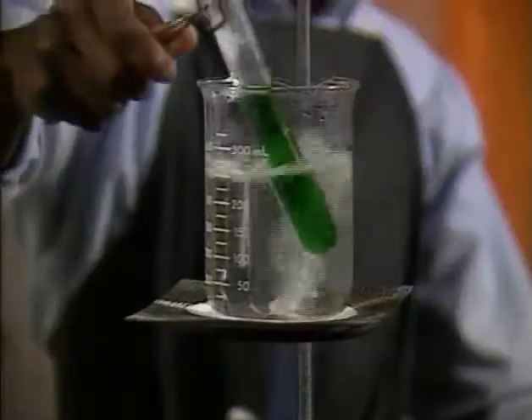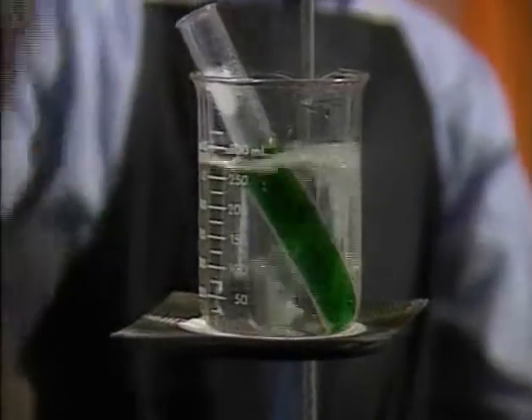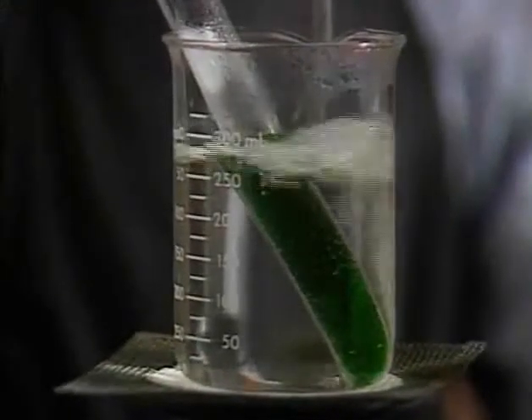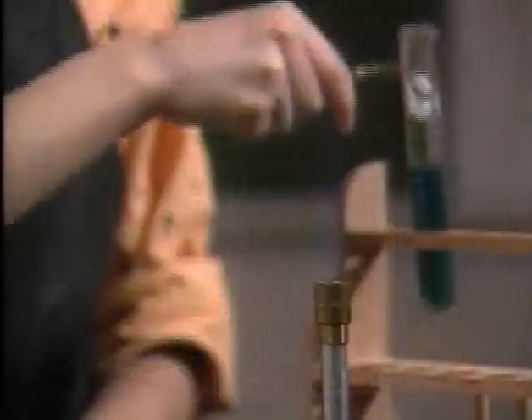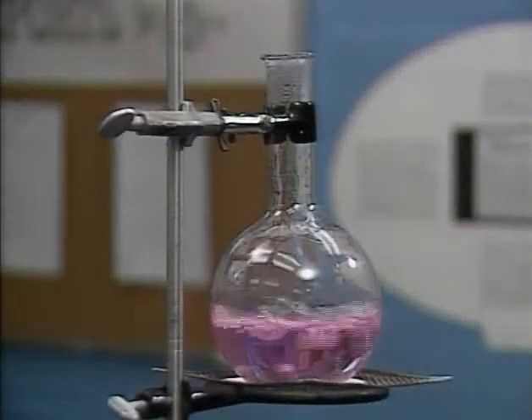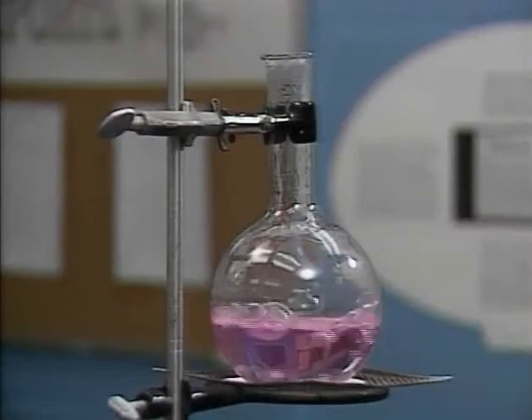Test tubes can be heated in a water bath, which transfers heat slowly and evenly and helps keep the contents from boiling over. You can also heat a test tube directly in the flame — hold it at an angle while moving it back and forth to distribute the heat evenly, and aim it away from yourself and your neighbors in case it boils over. Only heat containers with openings, as gas must be able to escape — a closed container can burst from pressure buildup.